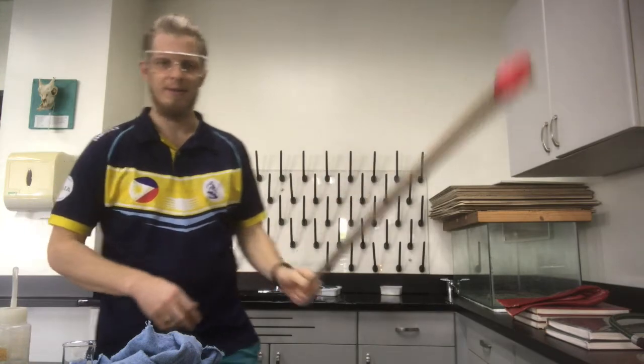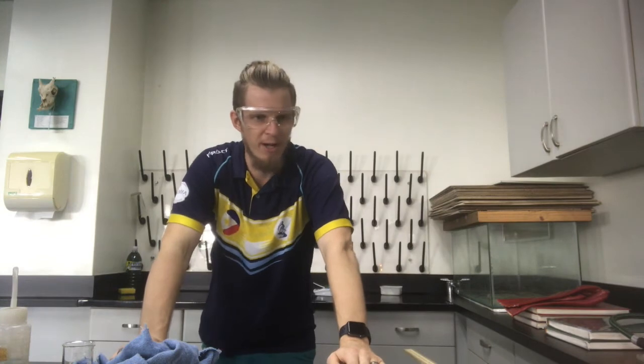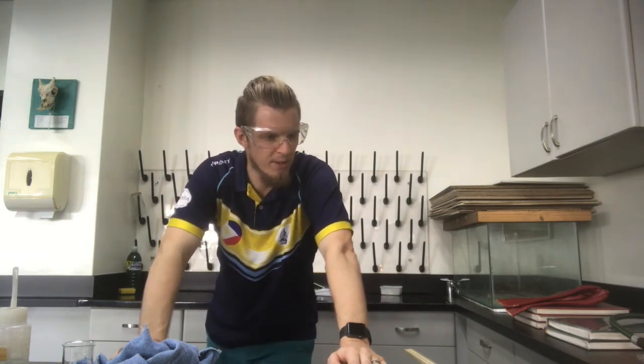Yeah, that worked well. So we got a bit of an explosion. That was a combustion reaction. Let me just turn the gas off, because the combustion reaction blew out the flame. It wasn't a full-on explosion, because even with my naked eye I could see the flame, and what I'll try to do in a second is give you a slow-mo of that if I can make it work on the editing software. Hopefully you got to see your synthesis, decomposition, single replacement, double replacement, and then finally our good combustion reaction.